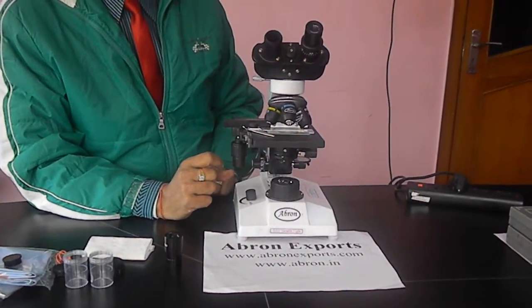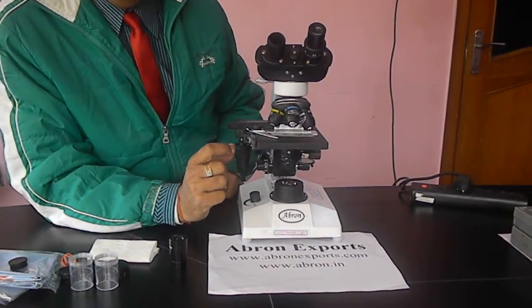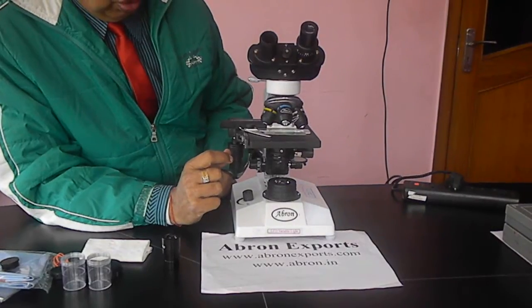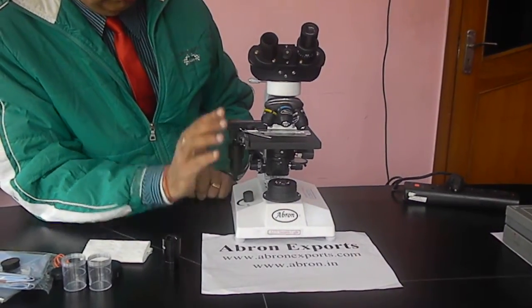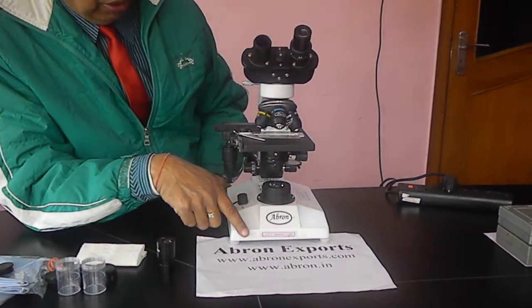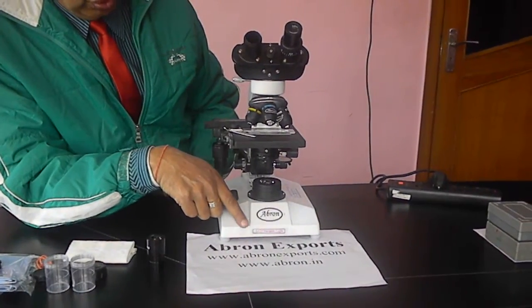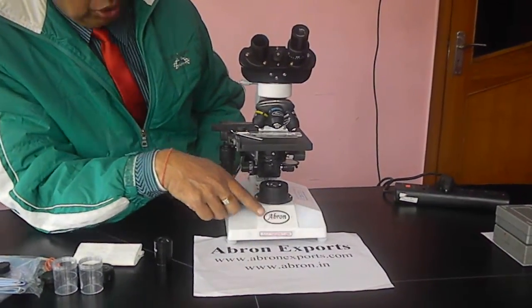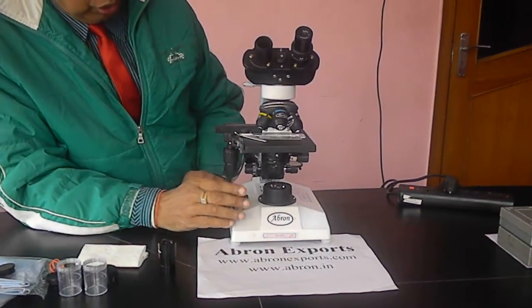Today we will learn how to use the microscope and get maximum quality from it. We are discussing the Abron Binocular Microscope, marketed and manufactured by Abron Exports. There are different parts you need to know.